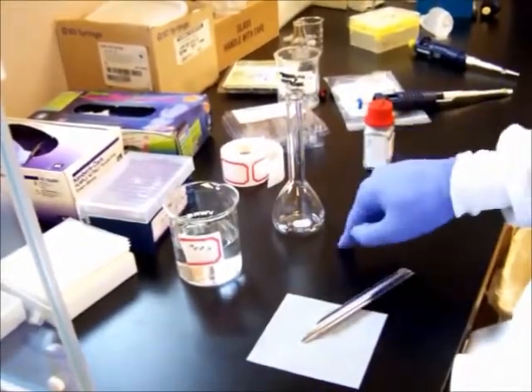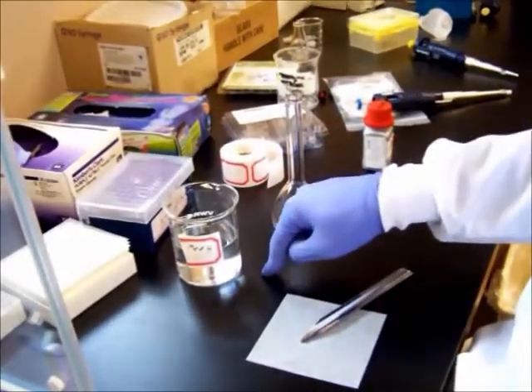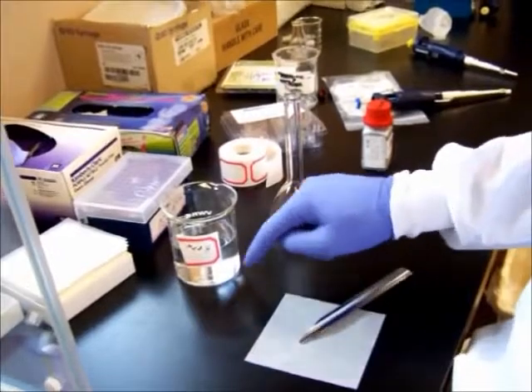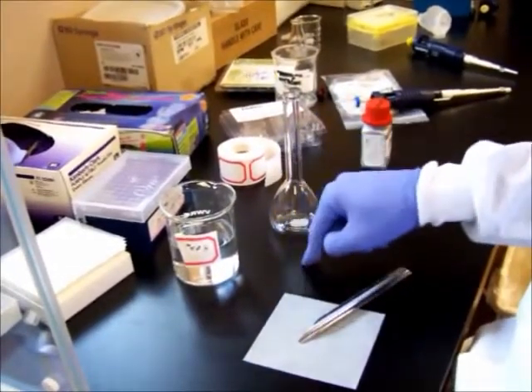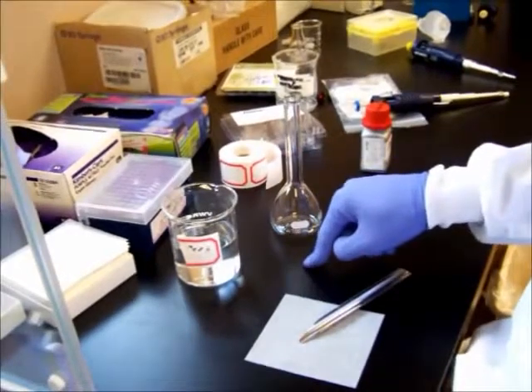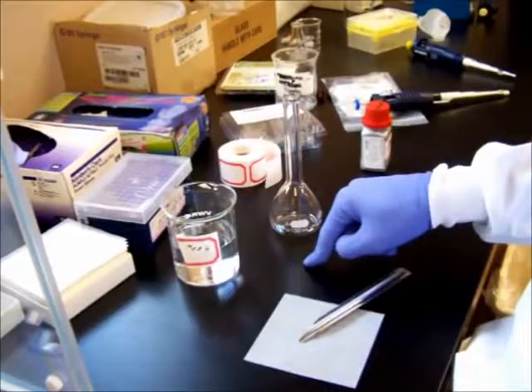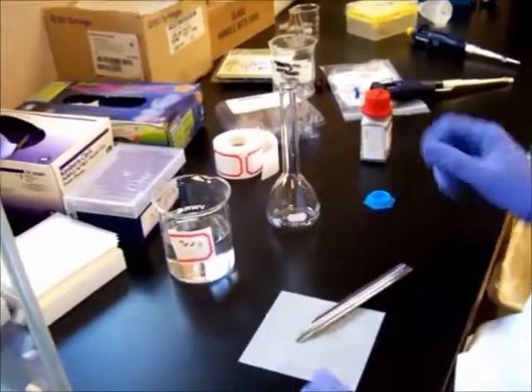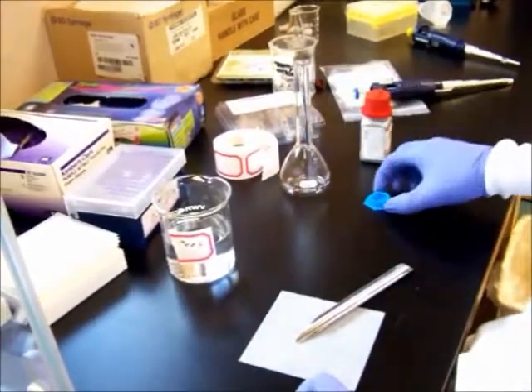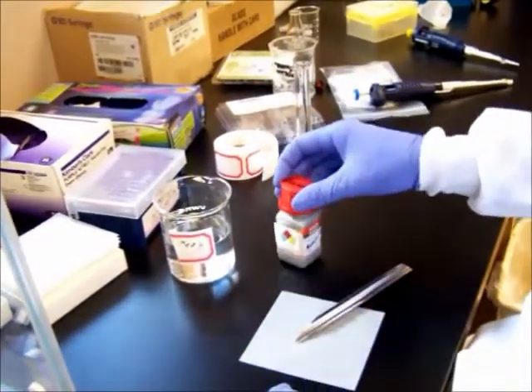Now both the flask and the beaker have been treated with a base bath, as we saw earlier, so we know that these are extremely clean right now. Anything that goes into the instrument needs to be extremely clean, or else it's going to be there forever. Whatever you put through the machine goes there forever. And since the machine is extremely sensitive, we need to keep everything extremely clean. So, the first thing we're going to do is measure out a small quantity of Naringin.